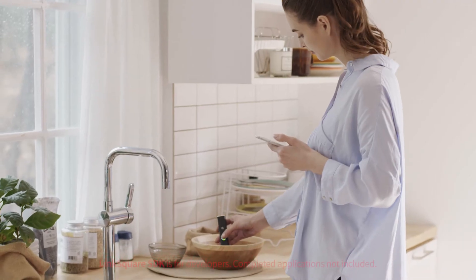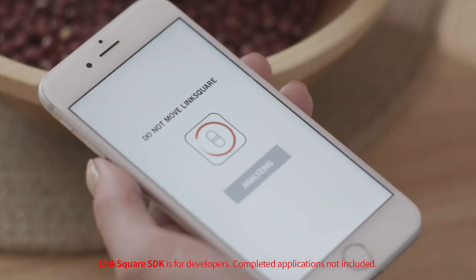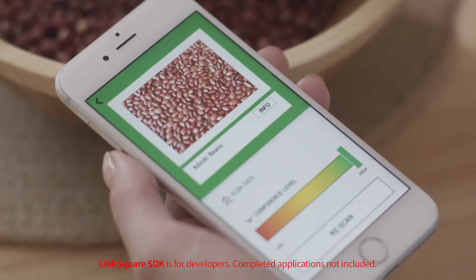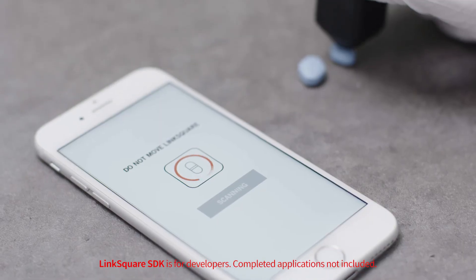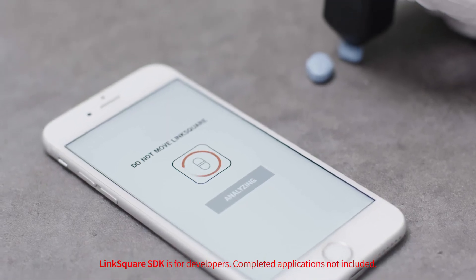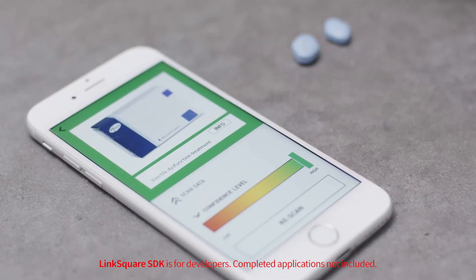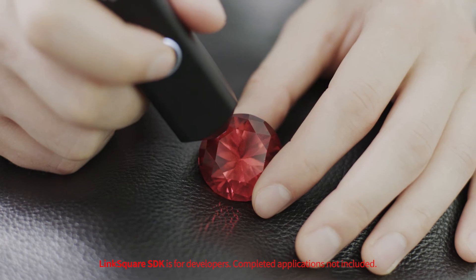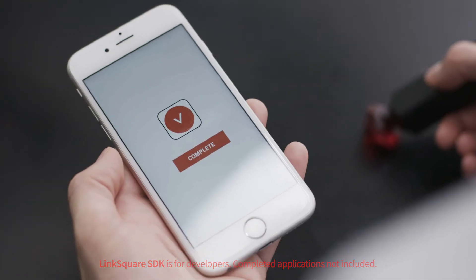As a developer, you'll be able to use the graphs you collect to create applications for personal use. You can create apps to distinguish between medications, validate the authenticity of gemstones, and much more.